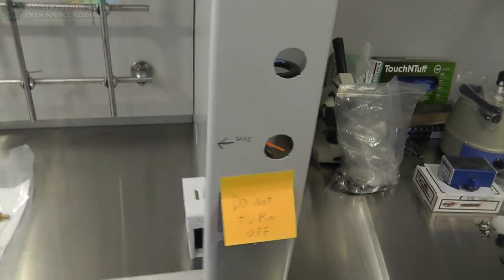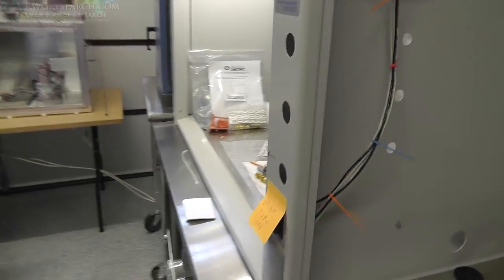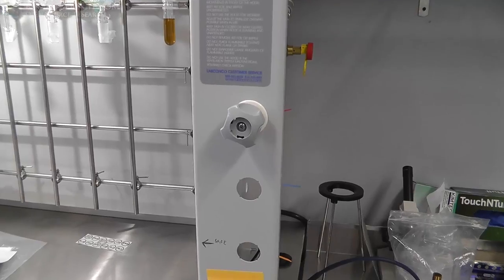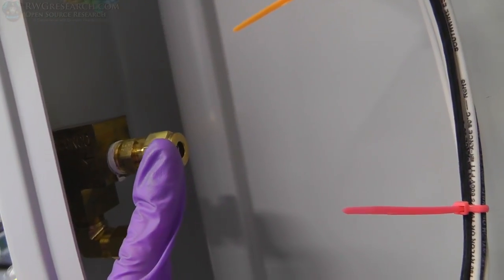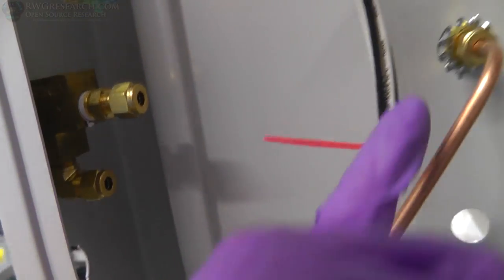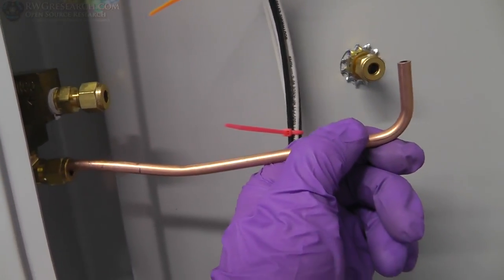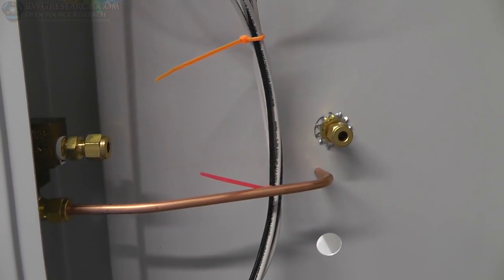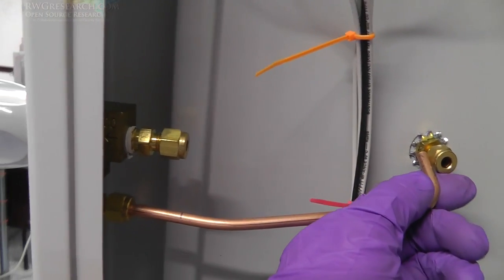So basically, I've taken the panel off here, and I've gone ahead and taken the caps out, so we'll assemble this thing and see how it goes. Not quite sure. Okay, I got this piece in here. I got this piece in here, which is the valve and the outlet. So the incoming gas goes here, and then we're supposed to put the outgoing gas, which goes to our lab hood, here. And as you can see, this is the tube they sent me. They say put it in here, and then put it in there. But look, couple of problems, but mainly the fact that it's too short in theory to even work.